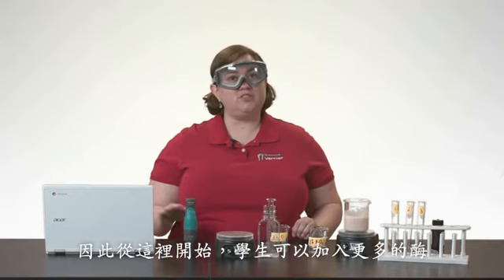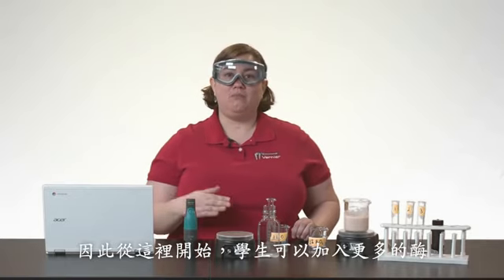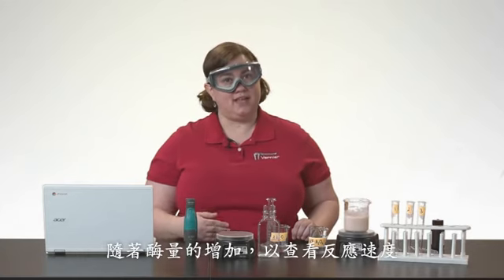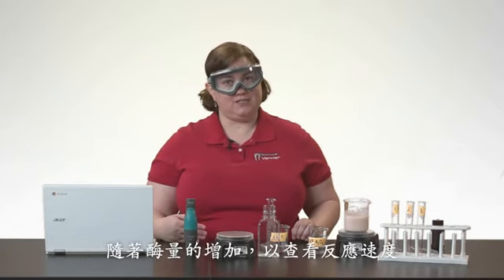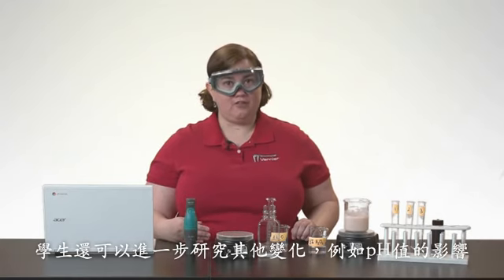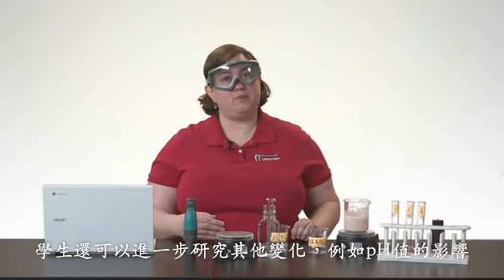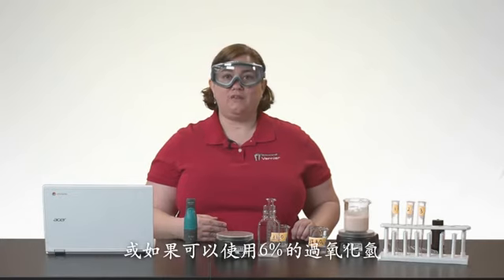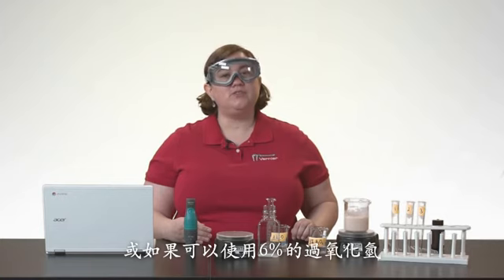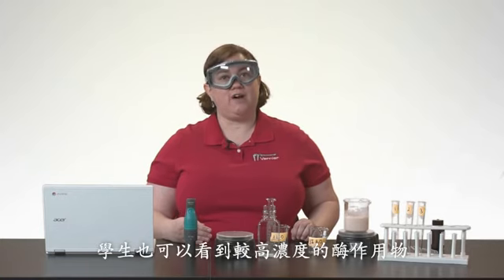So from here, students can then add more enzyme to see what happens to the reaction rate as enzyme amounts increase. Students can also further investigate other variables, such as the effect of pH, or if you have access to 6% hydrogen peroxide, students can also see the effect of higher concentrations of substrate.